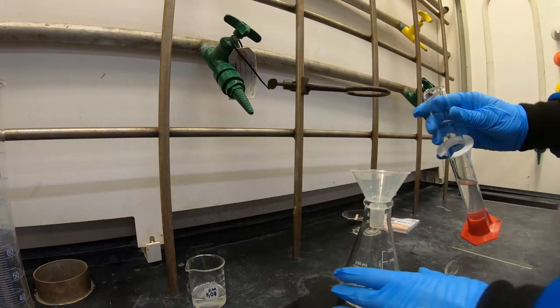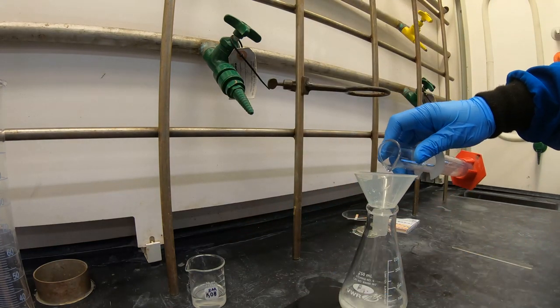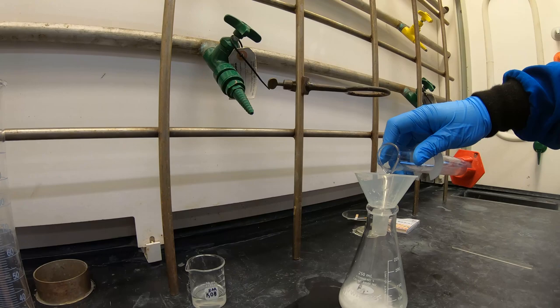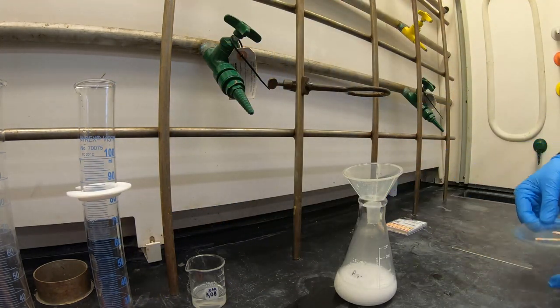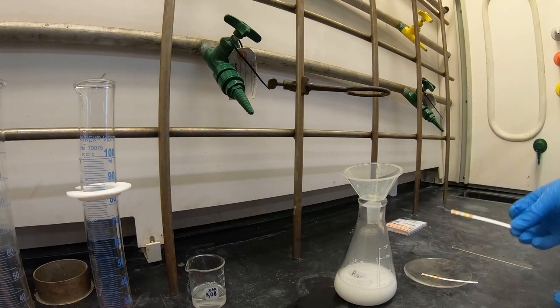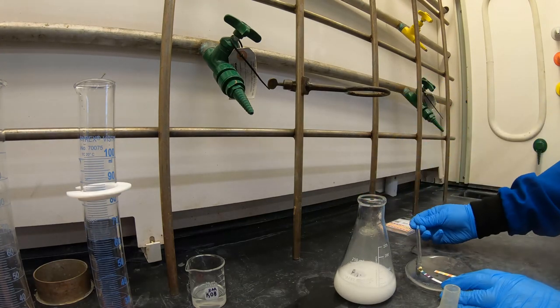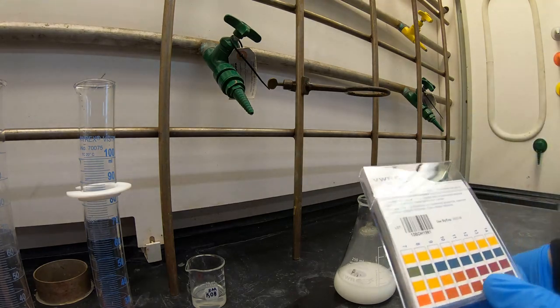Now make your solution strongly basic by adding 50ml of 8 molar KOH. We're expecting a cloudy and white solution to form. Now check the pH by dipping a stir rod into the flask and tapping the solution onto pH paper. Check that the pH is greater than 10.